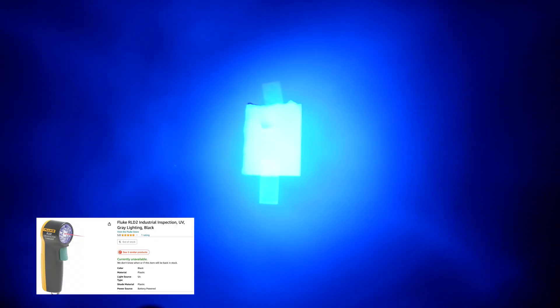One of the other ways that you can tell if you actually have the black lights in hand is to basically point it at a wall with something that fluoresces on the wall. So we have a piece of white paper up here. This is the Fluke flashlight. And you can see, yes, it causes the piece of paper to fluoresce. It shows up more brightly, but you also notice that there's just a halo of light around it. This is acting like a flashlight where it illuminates everything and not just the piece of paper which fluoresces. So this is a more even illumination, which is not really what we're looking for. This next one is the Ecolight. Again, not one we would recommend. And you can see it's a bit better. It makes it so that the piece of paper fluoresces, but there is still a halo of light around it.